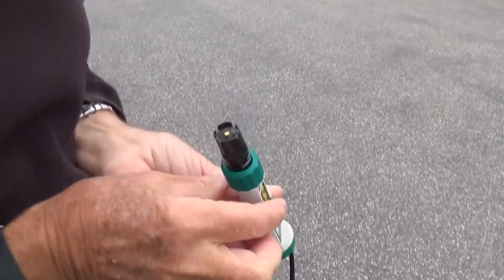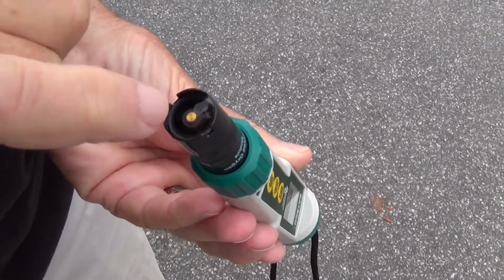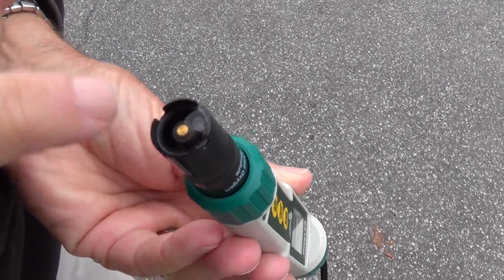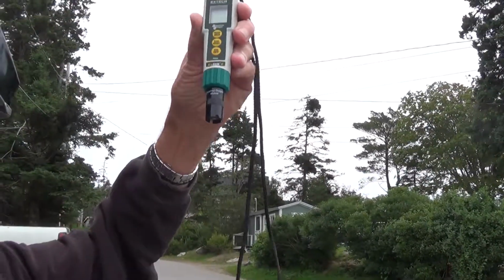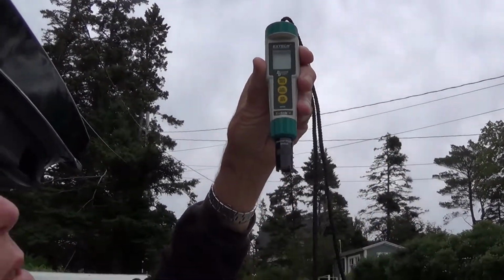Looking for tears. So you can see a bubble, probably at 3 o'clock. But it will disappear when you hold it up because that bubble rises to the top. Okay.